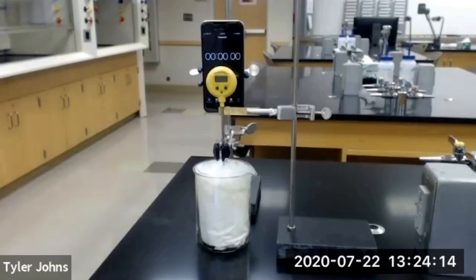You should now be able to determine the cooling curve of our solution and the molar mass of our unknown solute. This concludes part D of this experiment. Okay, students, you should now be able to calculate our freezing points, our freezing point depressions, and the molar mass of our unknown solute. This concludes our analysis of freezing point depression experiment.